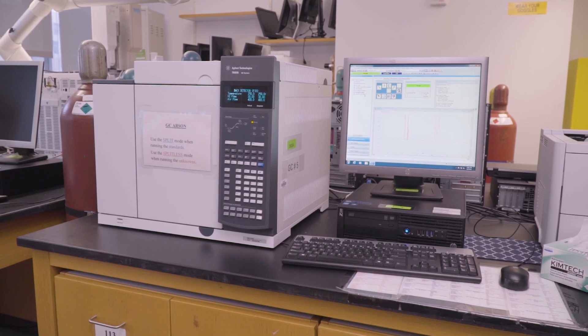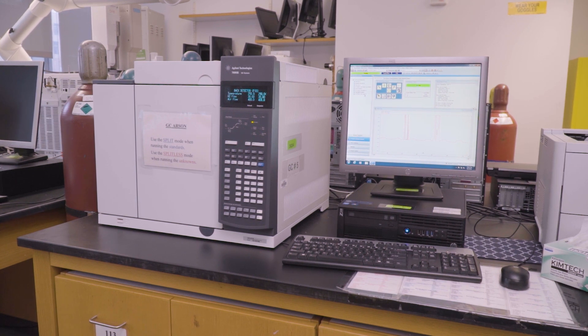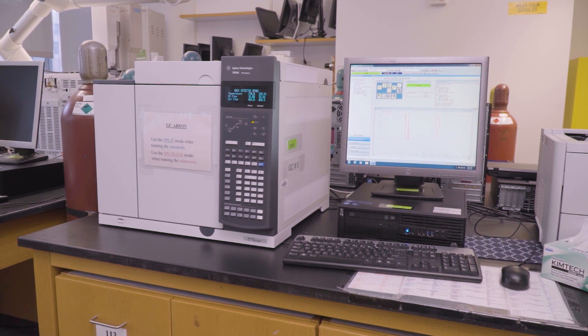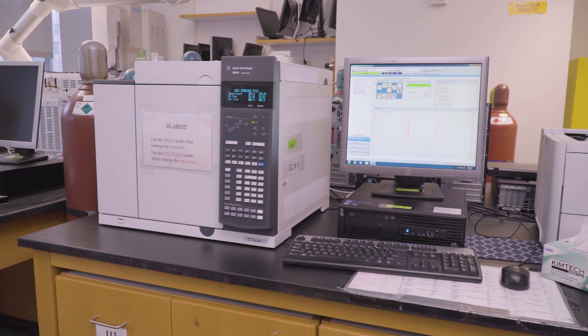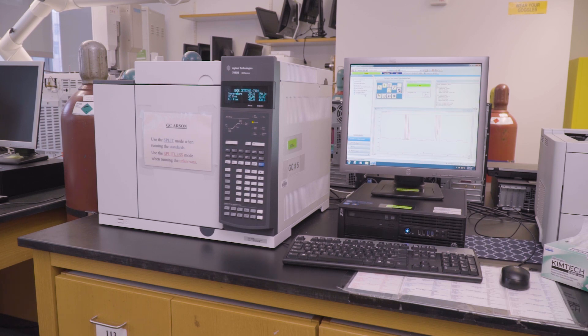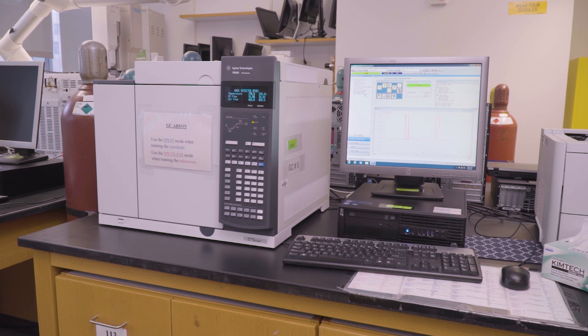Welcome to our equipment tutorial series. In this video, we'll introduce you to gas chromatography with Flame Ionization Detector, or GCFID. GCFID is a powerful instrument for qualitative and quantitative analysis of organic compounds, especially those that are volatile or semi-volatile. Let's explore.